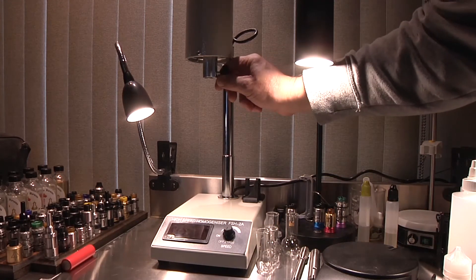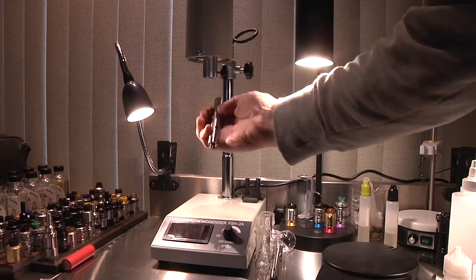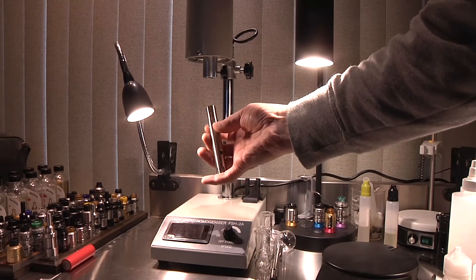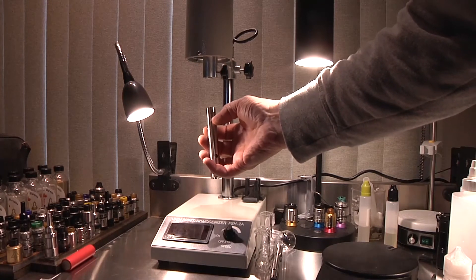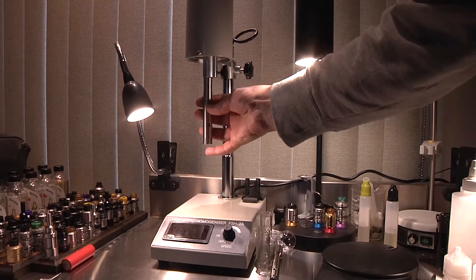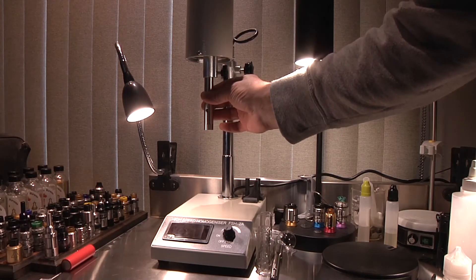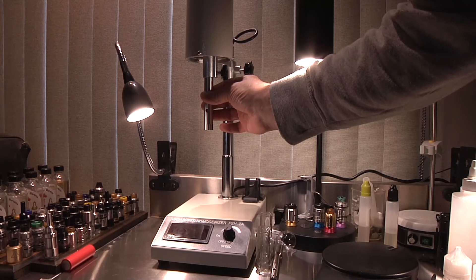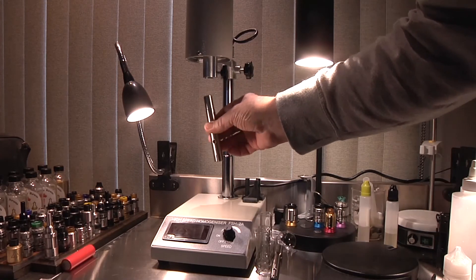On the bottom there's also another little twist knob that allows you to open up the area underneath where you put in the actual probes. You've got a little mark on the shaft that shows you how far the probes have to go in — they do have to go all the way up in there. Sometimes they don't want to do that; there's a little catch mechanism in there and you've got to spin them around and get them to grab.